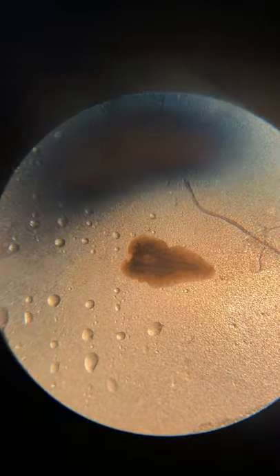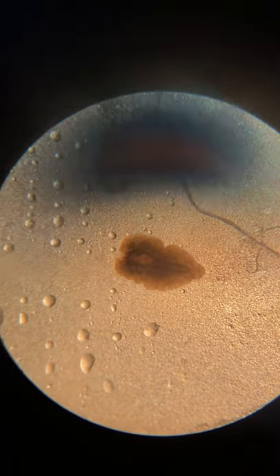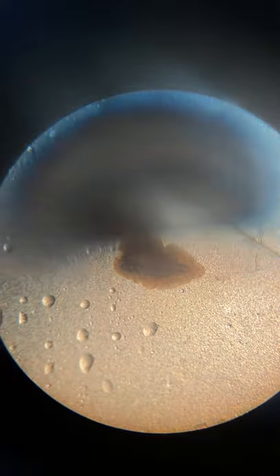See, it does move once I poke it. So it is alive, but it's taking a while to regenerate a head. Okay, so that's the lab — I'm going to go back through the microscope slides.